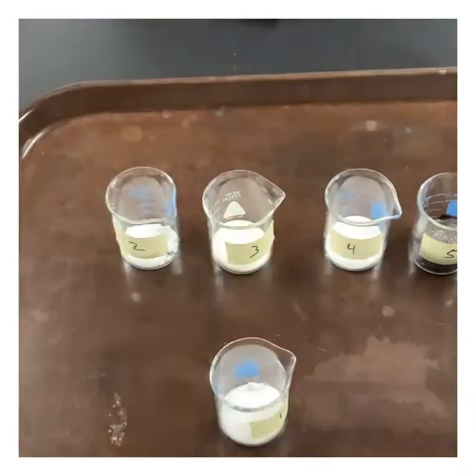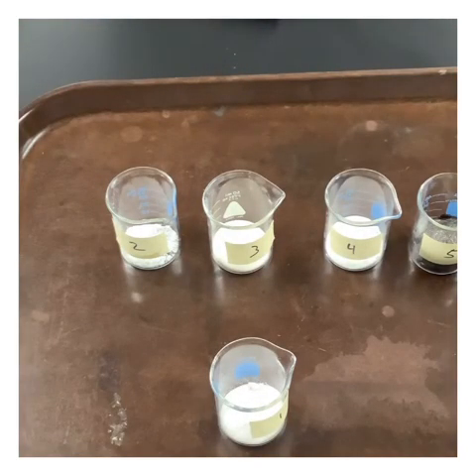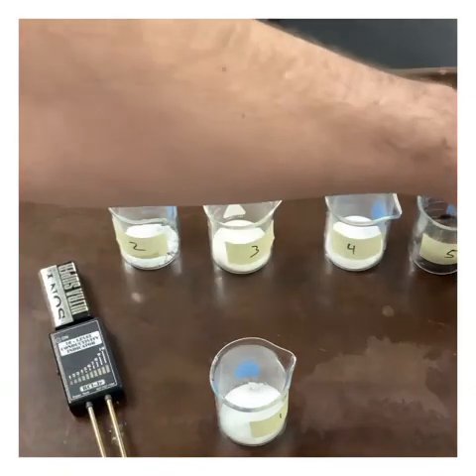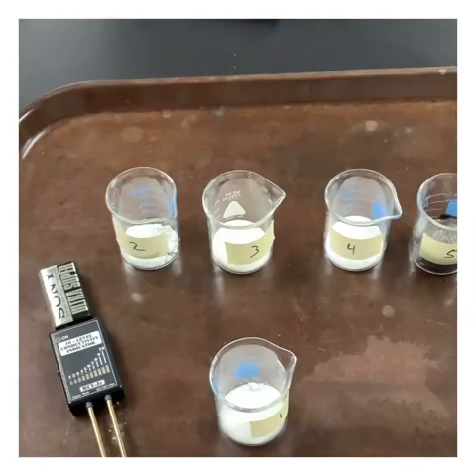All right, now what we want to do is, do we want to do it as a liquid yet? Yep, we do. Let's do it as a liquid. For the liquid, we're going to be using distilled water. And just to make sure that we are using distilled water, traditionally what you would want to do is get a clean beaker and test just the water.